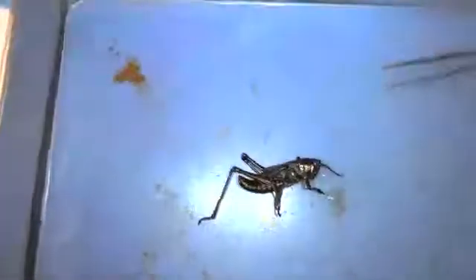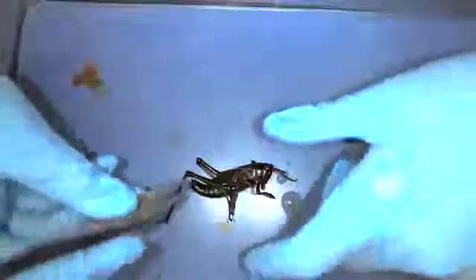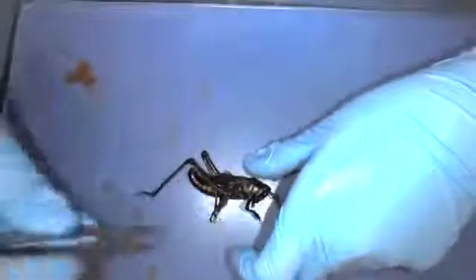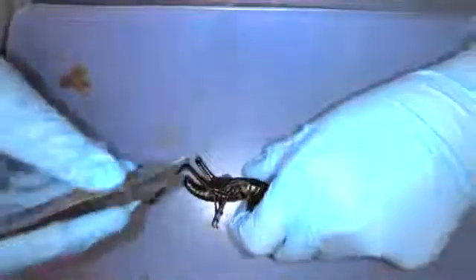So what we're going to do today is look at a grasshopper for dissection. I'm going to go ahead and flip my screen over to our little grasshopper friend. The grasshopper is a little interesting — if you've watched any of our demonstrations before, they don't have the same features as a lot of other animals you might see around.